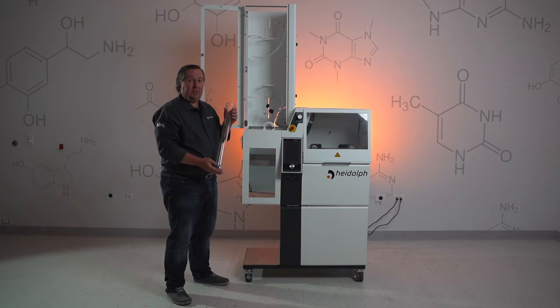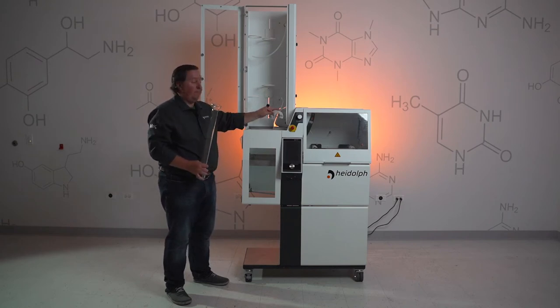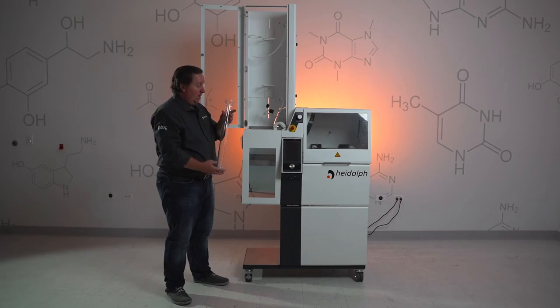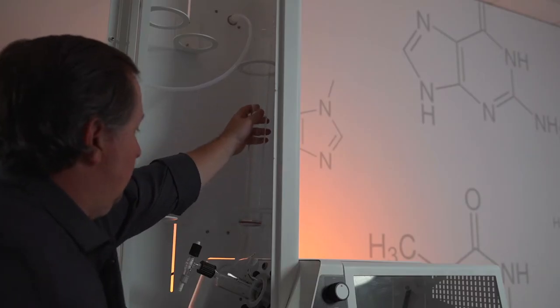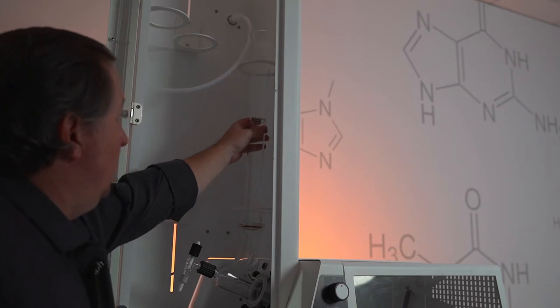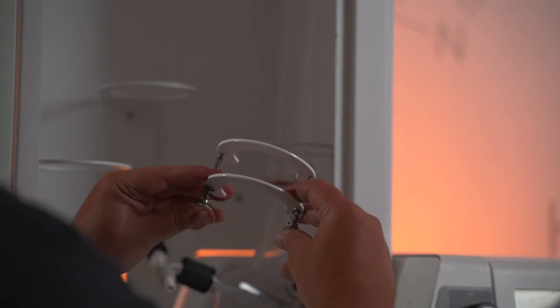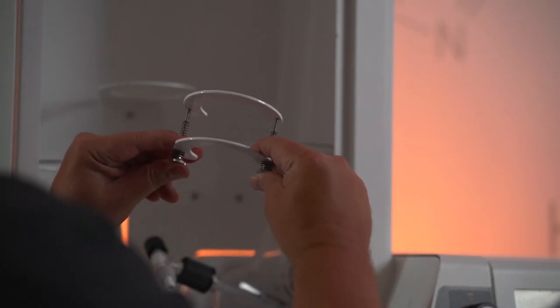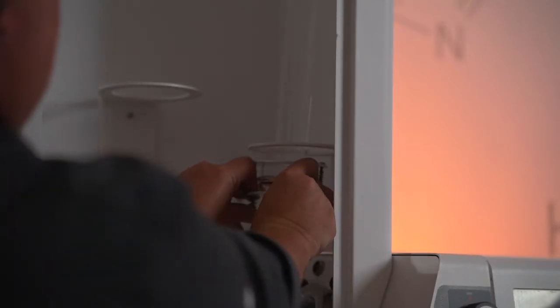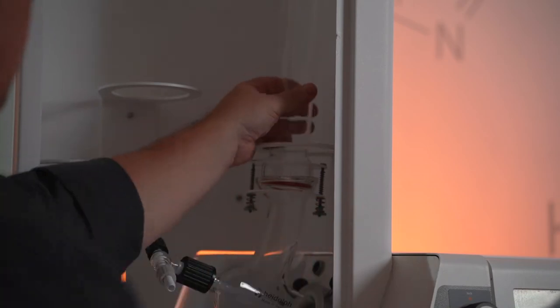Once you have your A distributor in place, grab your steam tube and a KS64 clamp and we're going to position this right above the A distributor. Once the steam tube is in place, grab your KS64 — you'll notice it's spring loaded. In order to get this on the glassware, just press down, slide it right over, give those screws a little turn, and you're good.